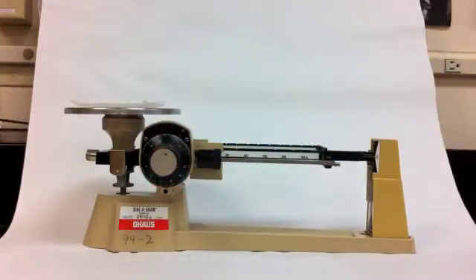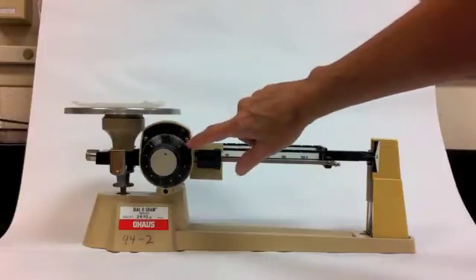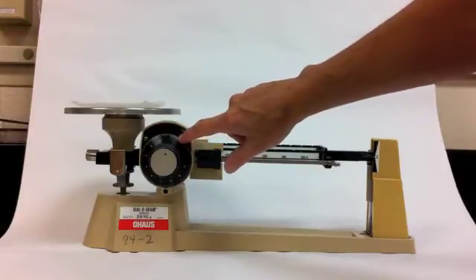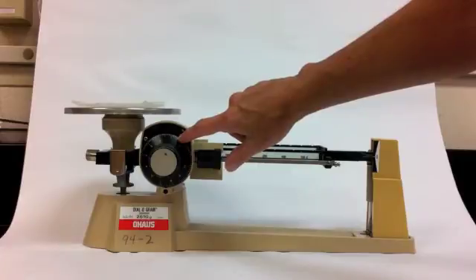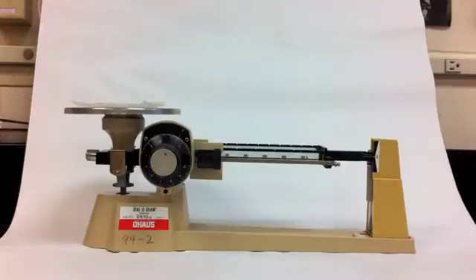And the mass is less than a gram. Here's the one gram mark. And mine is less than half a gram. So it's going to be 0.4 something. That something is my estimated digit.